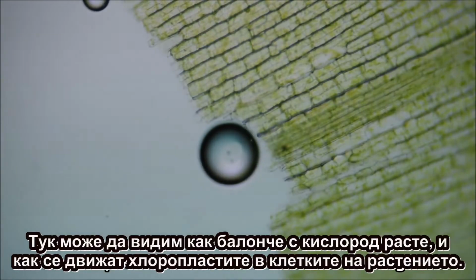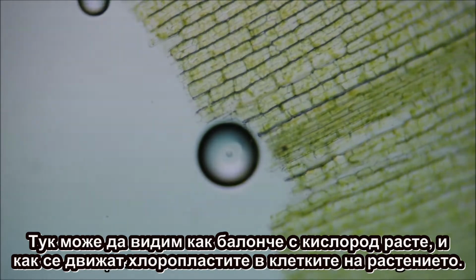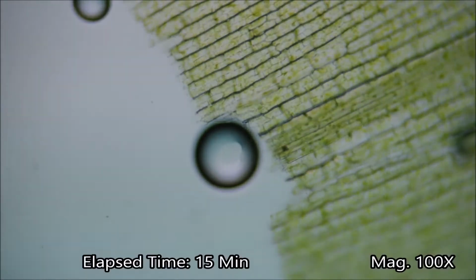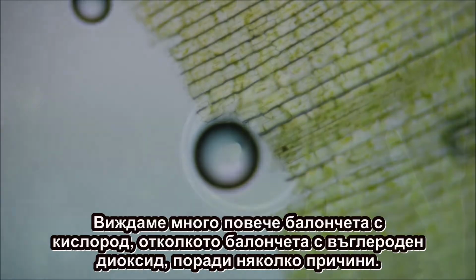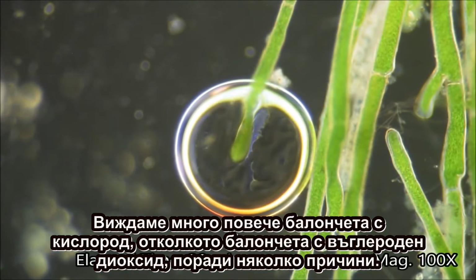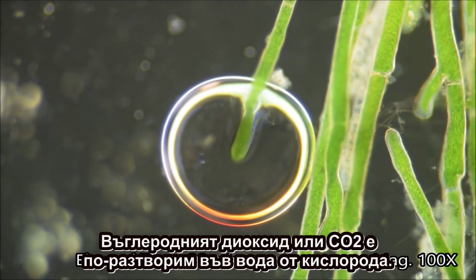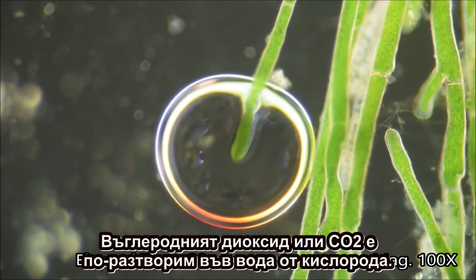Here we can see an oxygen bubble growing and the chloroplast in the plant cells moving around. We see a lot more oxygen bubbles than carbon dioxide bubbles for a few reasons. Carbon dioxide, or CO2, is more soluble than oxygen in water.